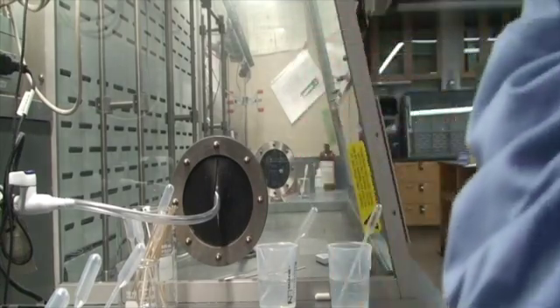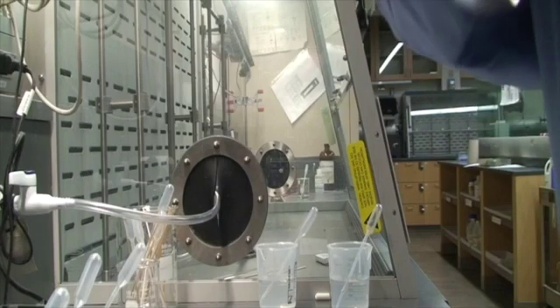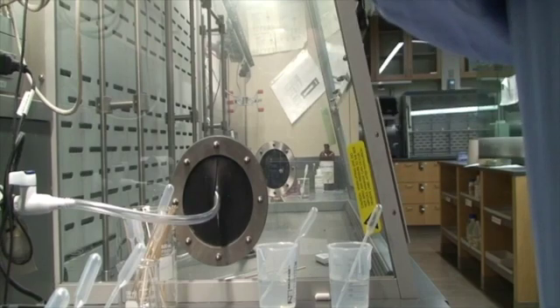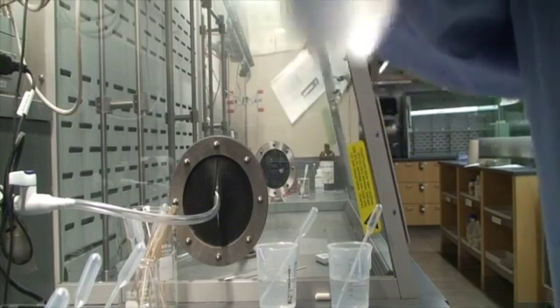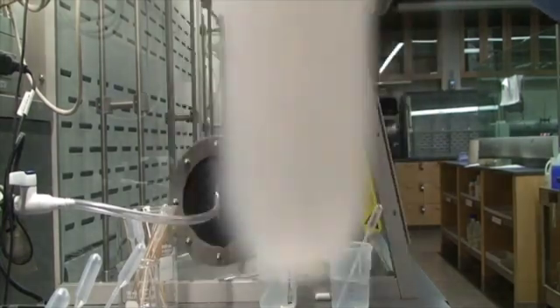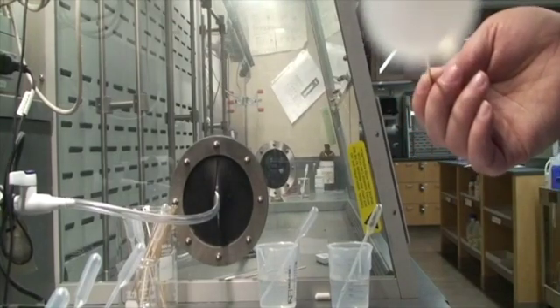So first glance, there's nothing going on there. Let's try to stir. Hey, it's getting a little cloudy. Getting cloudy. And there's a formation of a precipitate there. So adding sodium sulfate to unknown G gives me a precipitate.